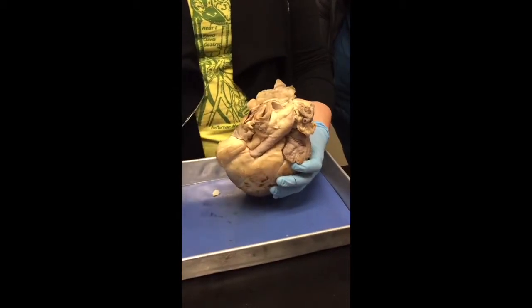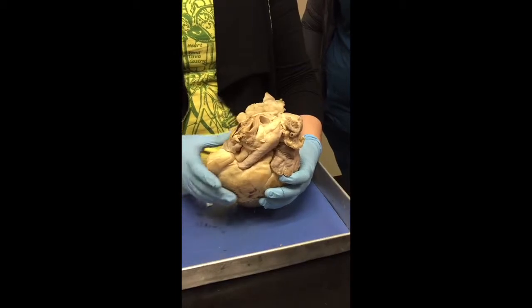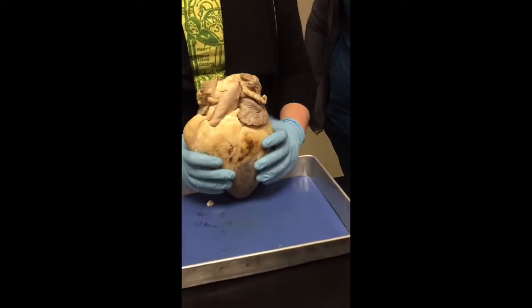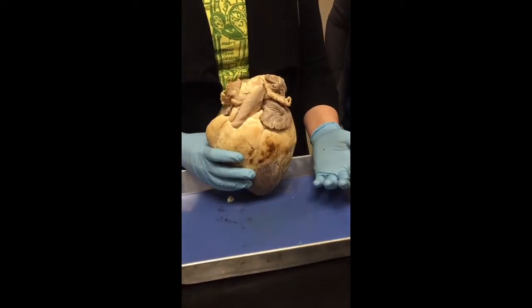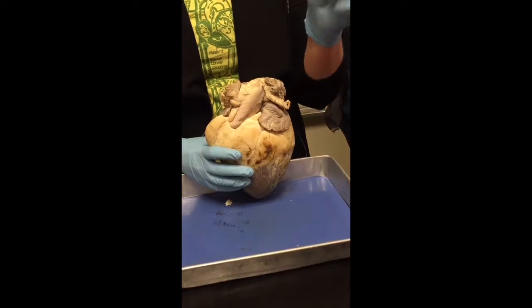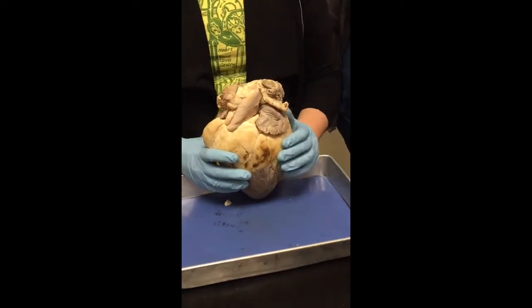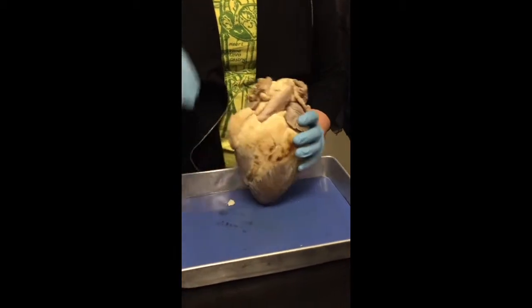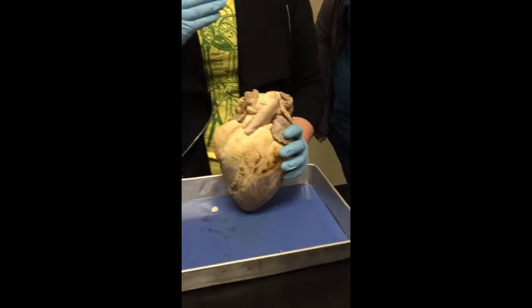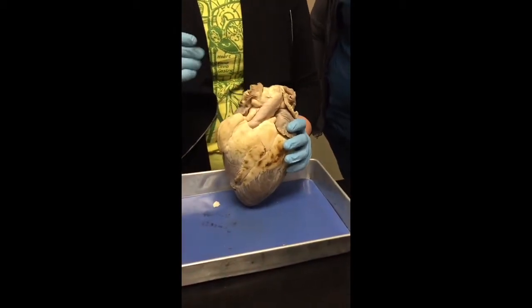From the aorta, through arteries, then through arterioles, and then to capillaries, okay? The only difference between an artery and an arteriole is going to be the amount of smooth muscle and its diameter, okay? Arteries have a larger diameter. Arterioles, oles means small or little, so it has a smaller diameter. And then capillaries, pretty much, they're large enough just to let a red blood cell by, right? So if you can only go single file through capillaries, does that mean it's going to be real fast or real slow?